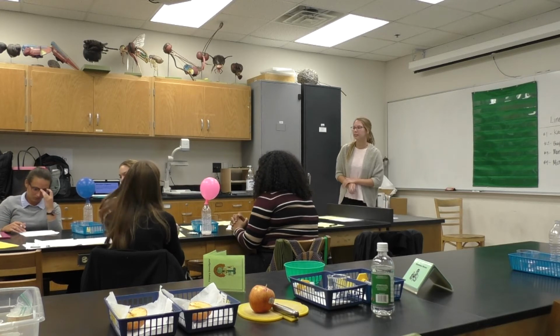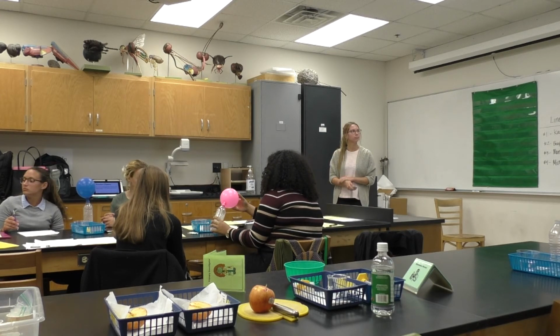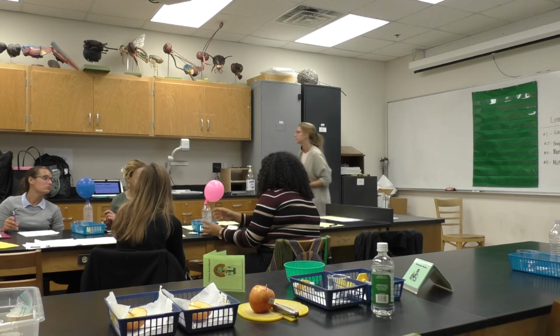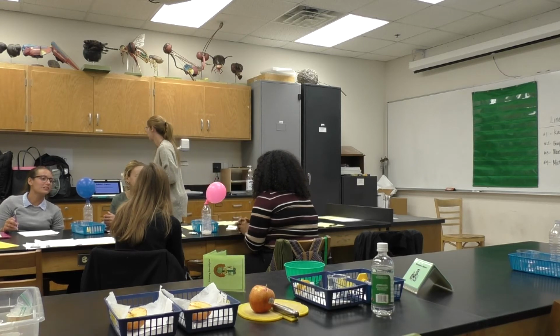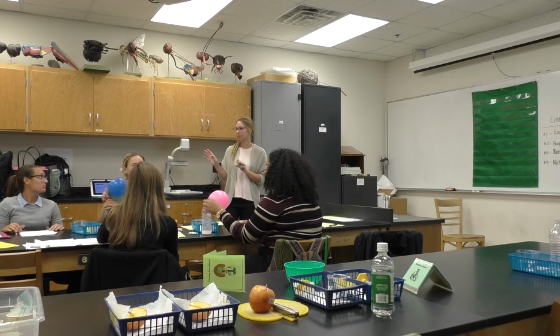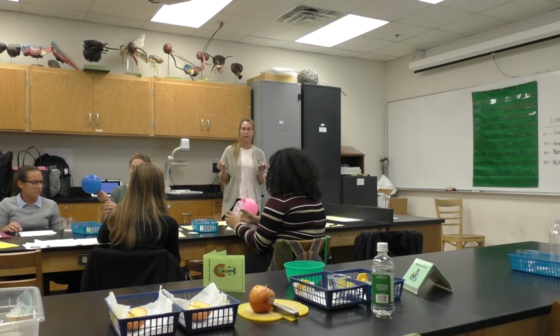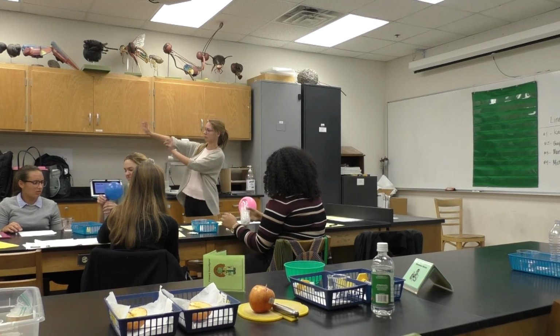Is everybody finished with your exploration guide? Materials and maintenance, if the maintenance director could begin the cleanup process, all the liquids can go in the sink. They're not dangerous or a potential hazard. Also, the materials manager will make sure everything's accounted for. So go ahead and dump all the liquids in the sink.